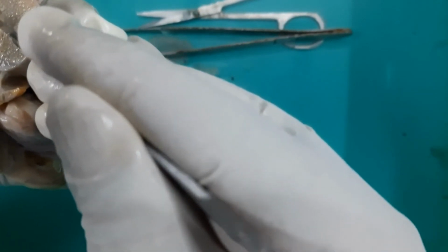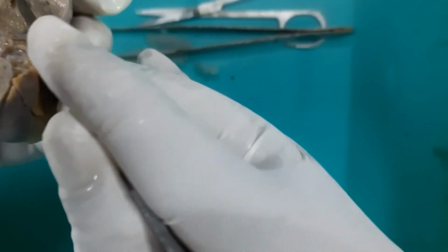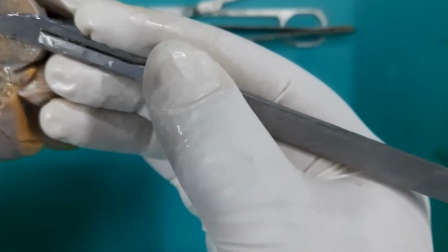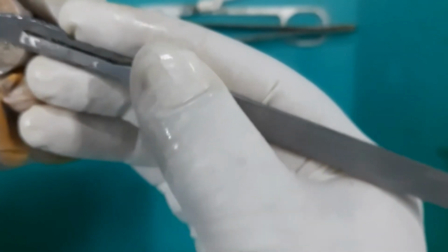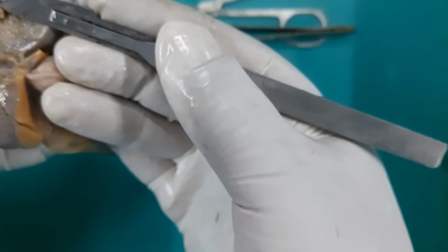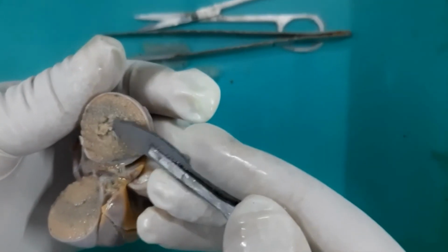Okay, and these tubules are responsible for the production of the spermatozoa, sperms. I cannot show you the septa, they are fine structures, lobules, but the seminiferous tubules, if you try to lift it with the tip of a pin, you can just lift some of the seminiferous tubules up, okay, some of the seminiferous tubules here. So these are the fine seminiferous tubules which are present.